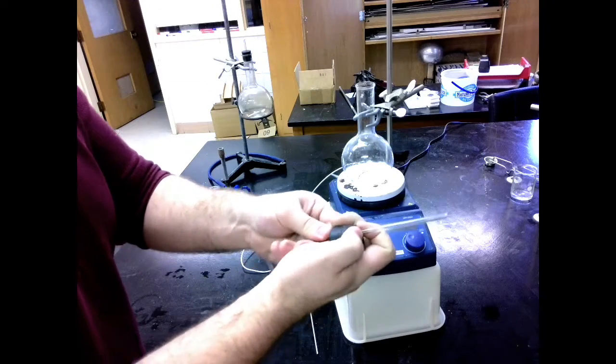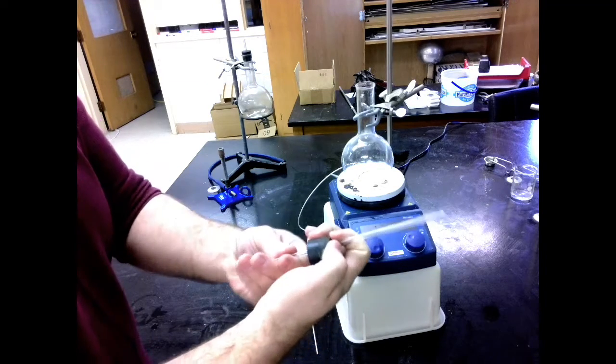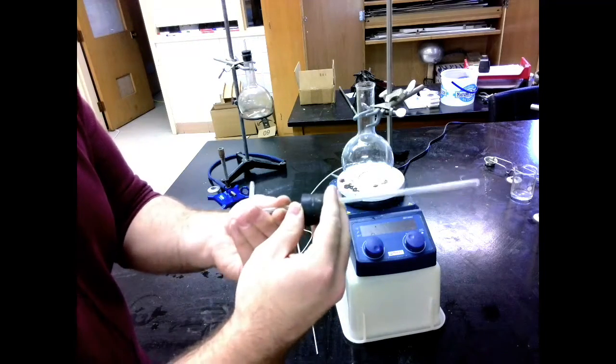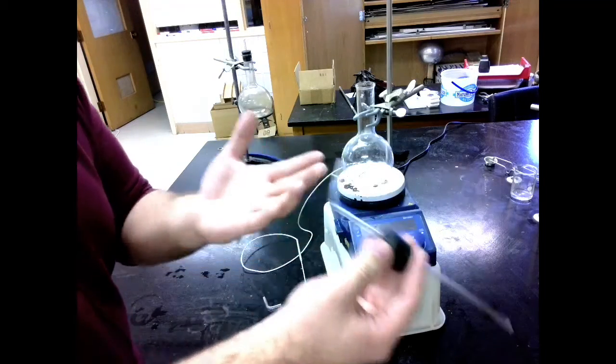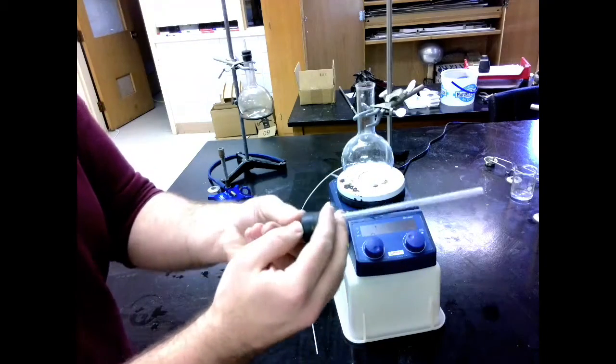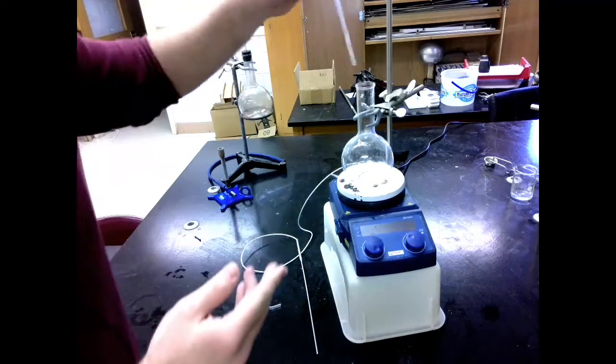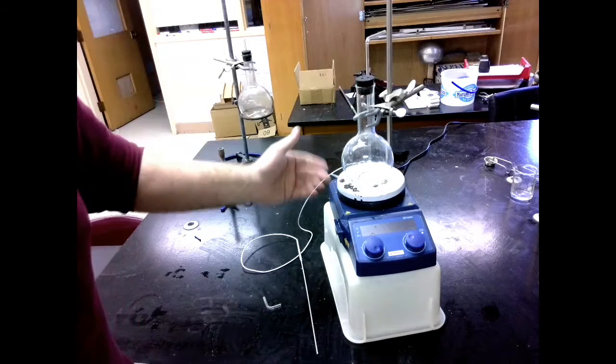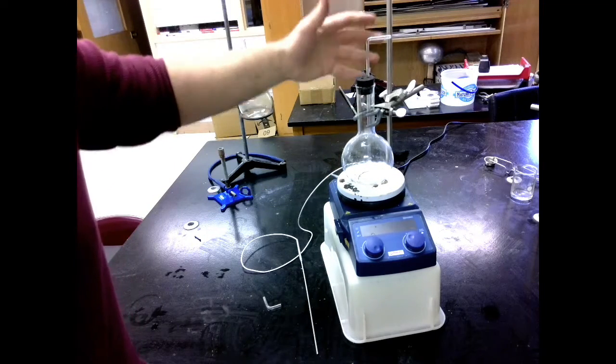Make sure you're using some lubrication. I'm reminding you of that because it can be very easy for these to get stuck and then try and push and it shatters and the glass goes into your hand. So we're going to use lubrication to make sure it's nice and easy. Don't want anyone to get hurt.